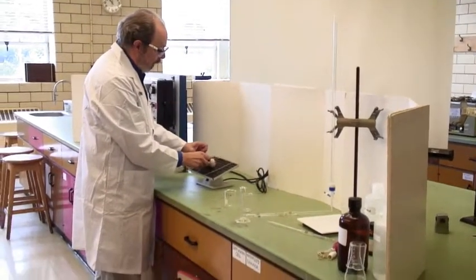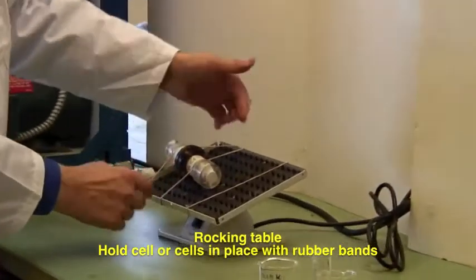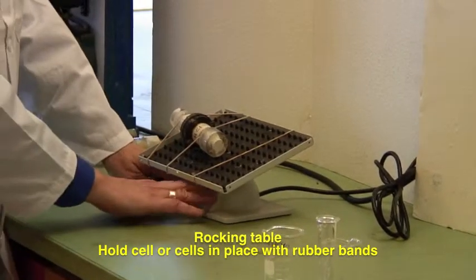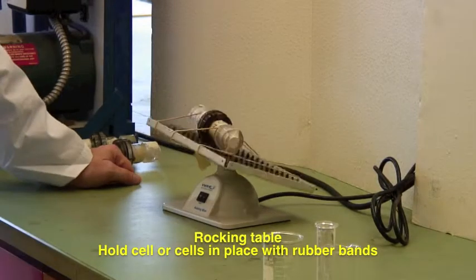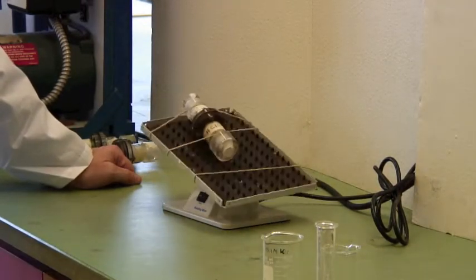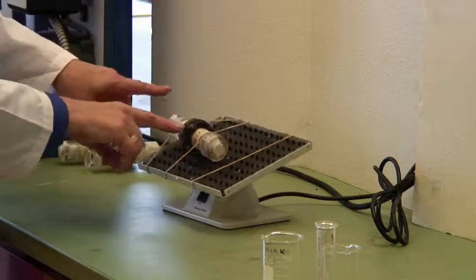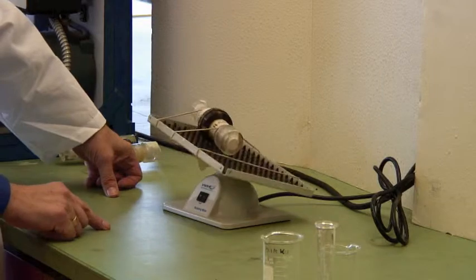It's designed for blood labs, actually. You need to hold it in place just by using the elastics and push the switch. And that rocking motion is enough to make sure that you've got uniform concentration gradients inside the cells themselves.